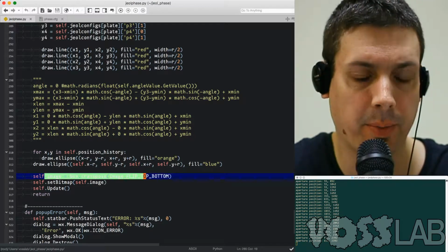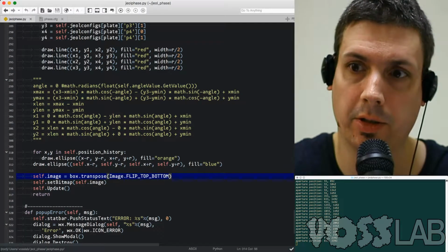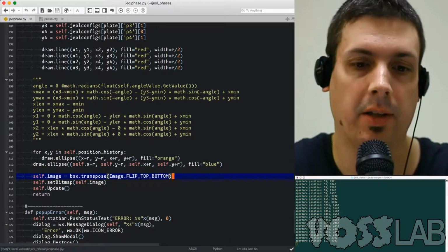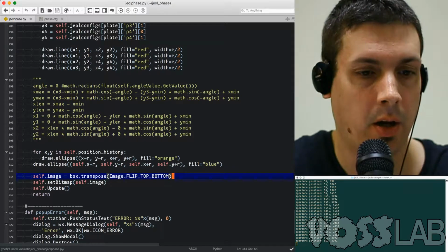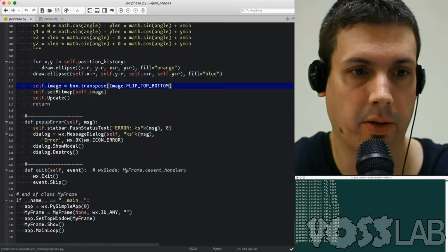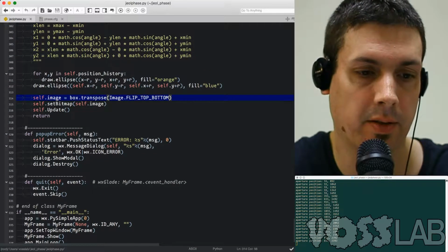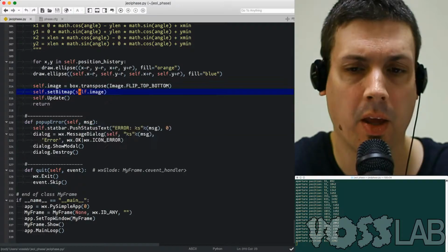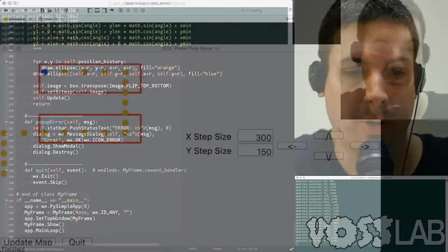Again, I am still flipping the image because I do like Cartesian coordinates with the 0 at the bottom left corner rather than image coordinates where the 0 is at the top left corner. And then I use that set bitmap function. I'm not using the rest of this code here for the most part. This just kind of launches the window. This is the quit button. This is not used. So anyway, fun program to write.